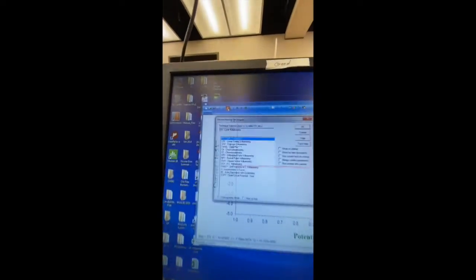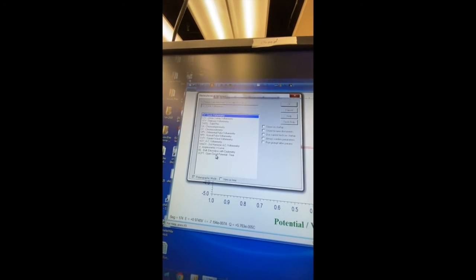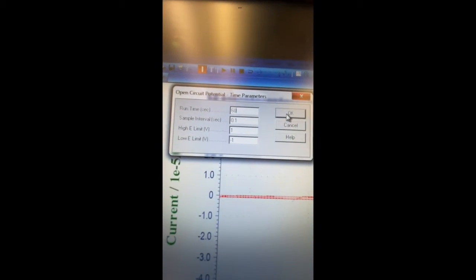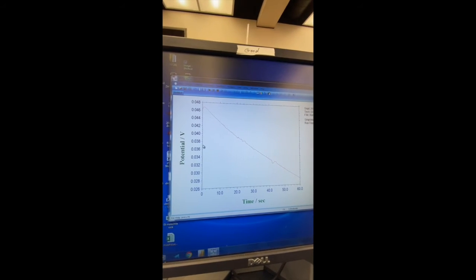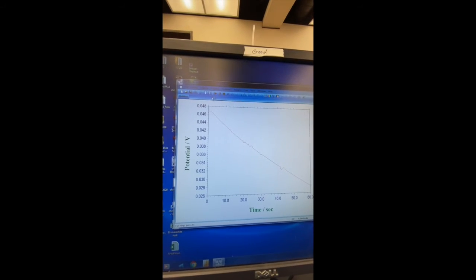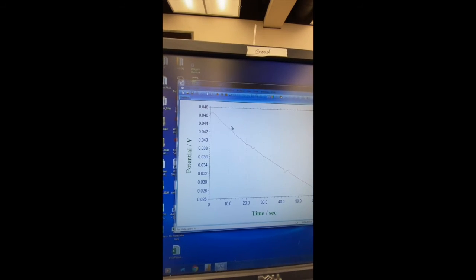We're going to start with an OCP. So I'm going to click the technique button. At the bottom here you see open circuit potential. And we're going to do 60 seconds here just to come up with the equilibrium voltage. So we have here the finished OCP, and we're going to find the equilibrium voltage by taking the center of the chart and coming over to the left here. So we're going to say it's about 0.037 or so. So we're going to take that value and apply that to the cyclic voltammetry, the CV, as our initial voltage.